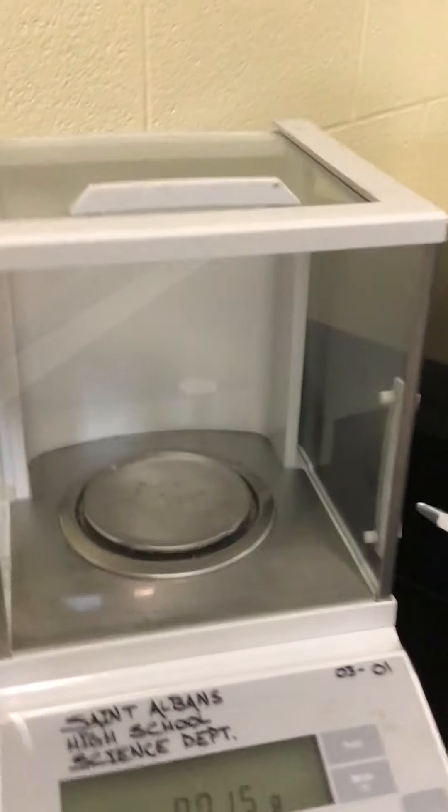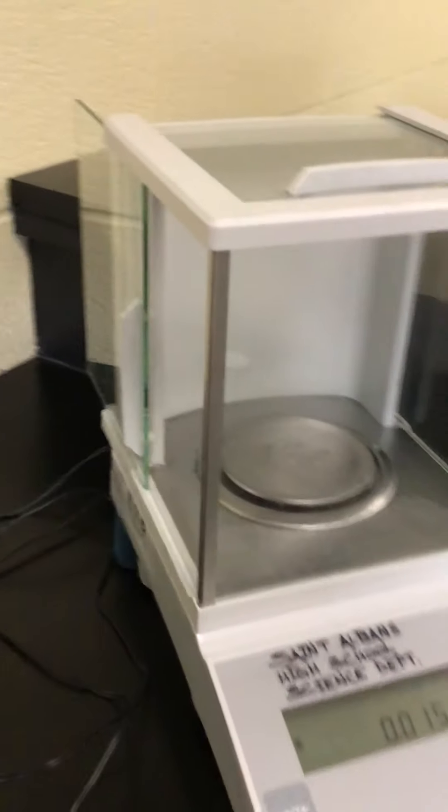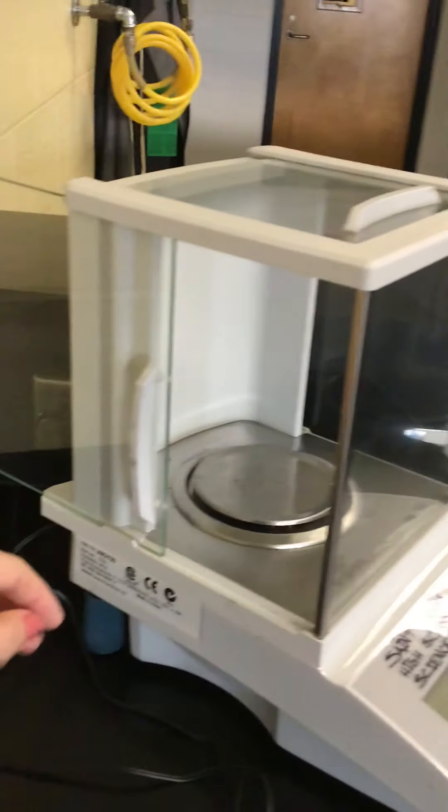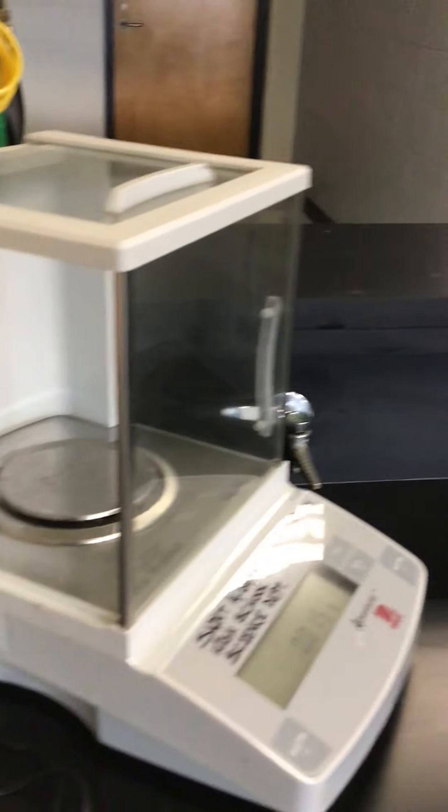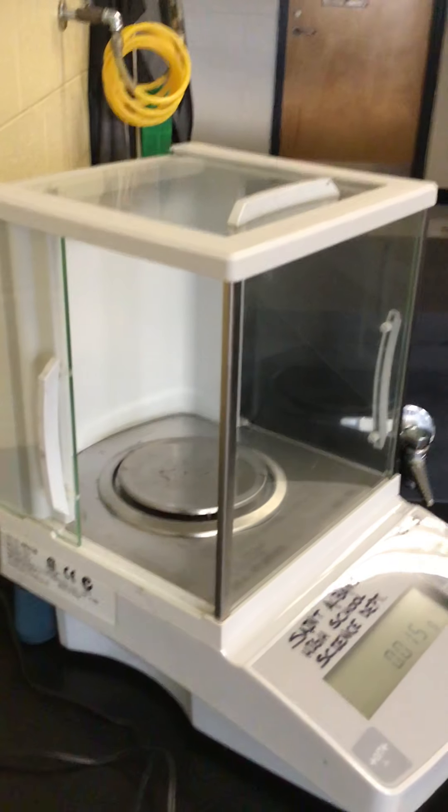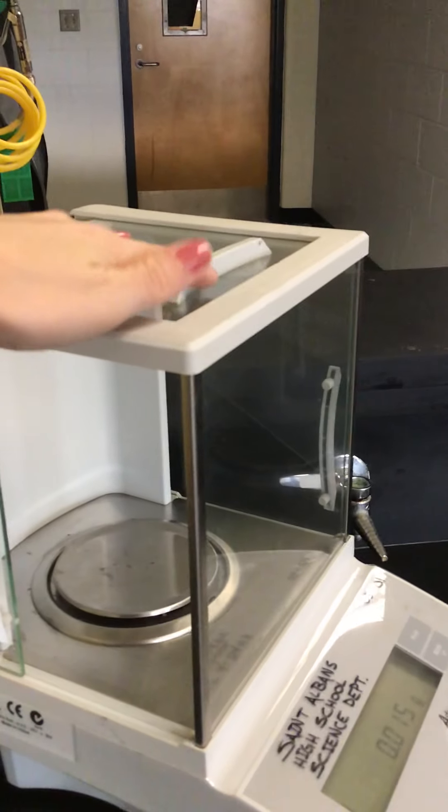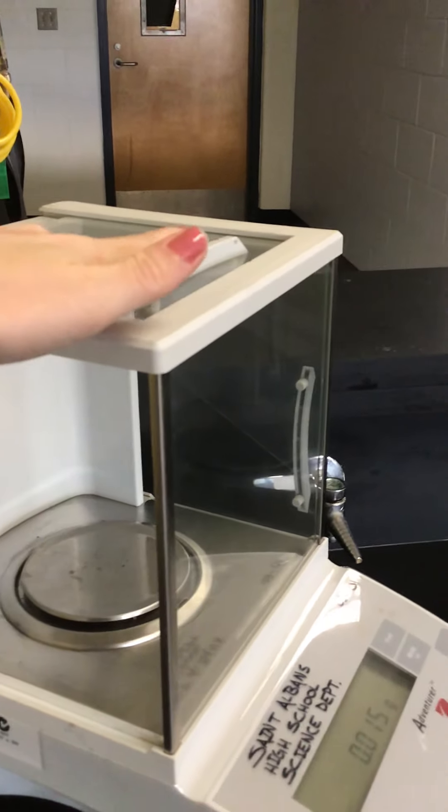So another consideration when using these kinds of scales is that they have doors on them and this one's kind of nice because it has a door on both sides but it also has a door that I can slide open and shut on top.